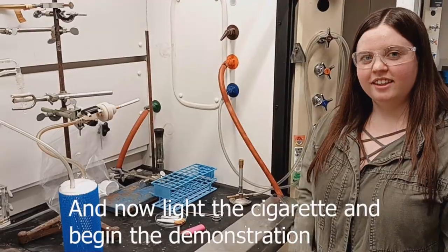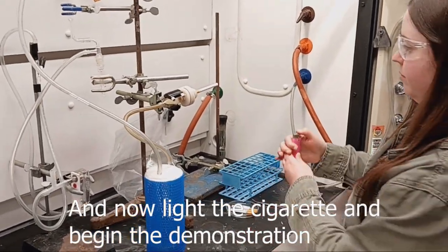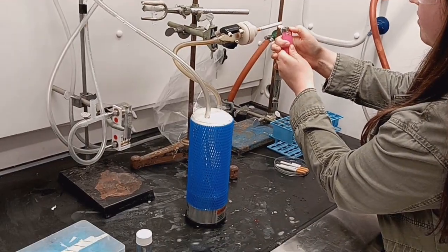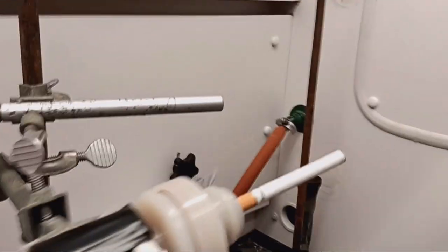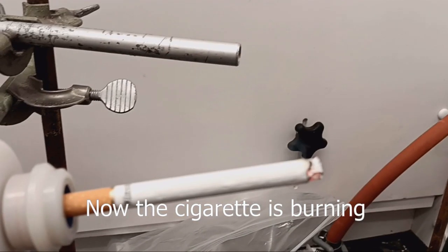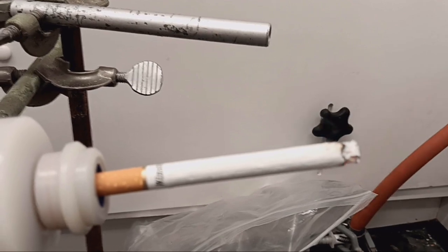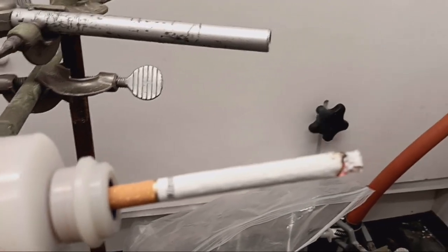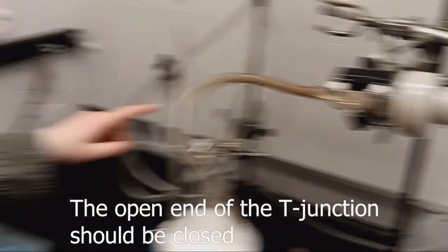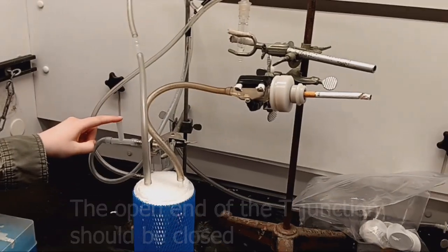And now light the cigarette and begin the demonstration. Now the cigarette is burning. The open end of the T-junction should be closed to perform puffs and open between puffs.